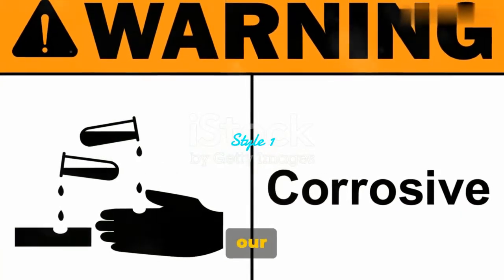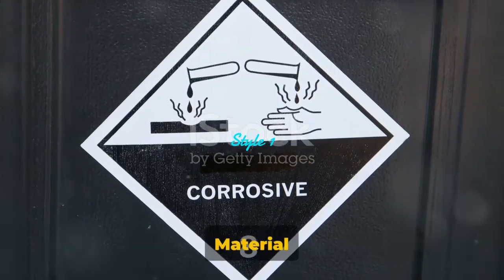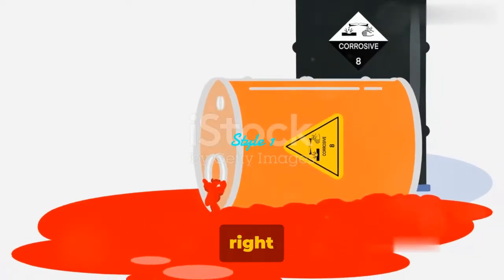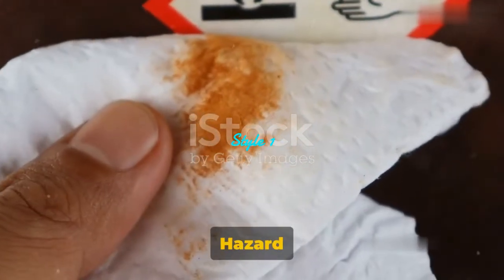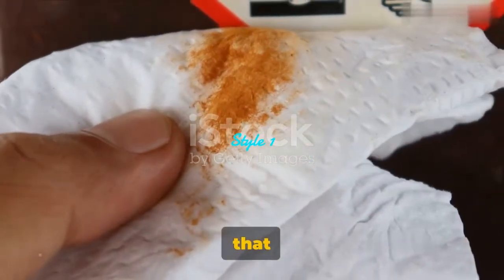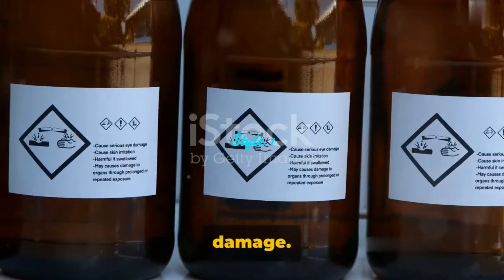Let's now turn our attention to the symbols for corrosive material hazard and harmful irritants. Diving right in, the corrosive material hazard symbol is a visual alert that the substance in question can cause severe damage.